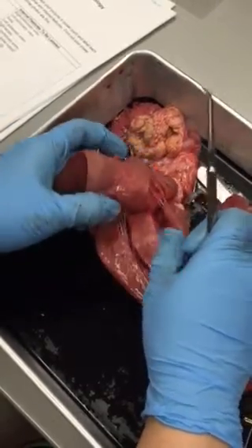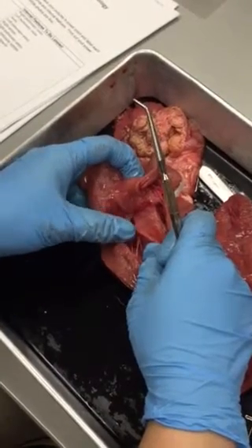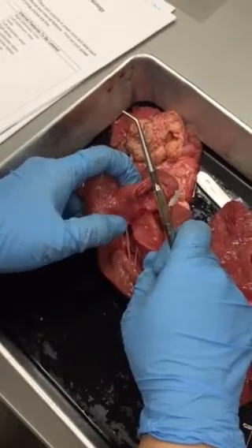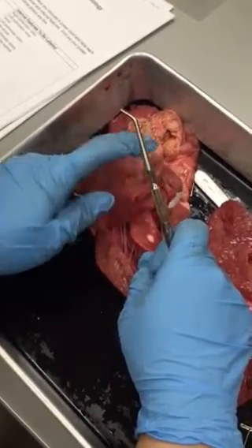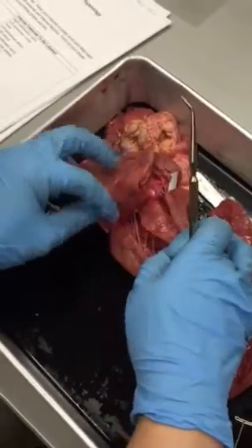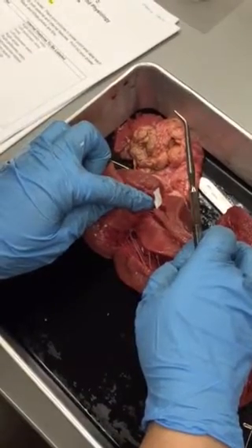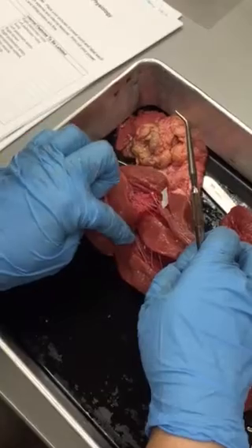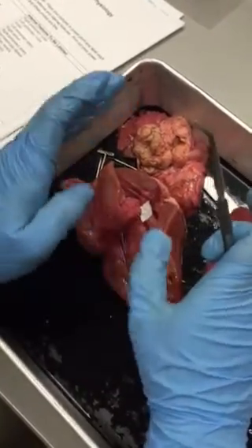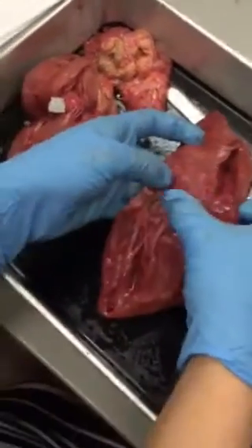On the left side, it has two flaps, so we call it the bicuspid valve or the left atrioventricular valve. Some people also call it the mitral valve. So the left one has 3 names, the right one has 2 names. I don't care which set you use, but if you call this the mitral valve or the bicuspid valve, then this one has to be called the tricuspid valve. If you call this the left atrioventricular valve, this has to be the right atrioventricular valve. You have to keep your name pairings the same. So that's those two valves.